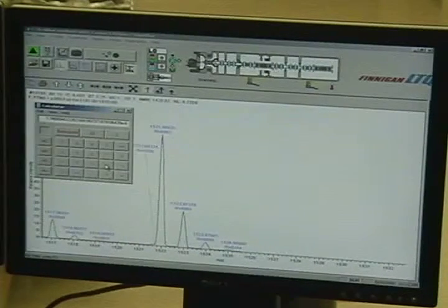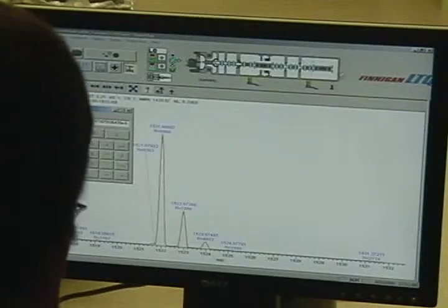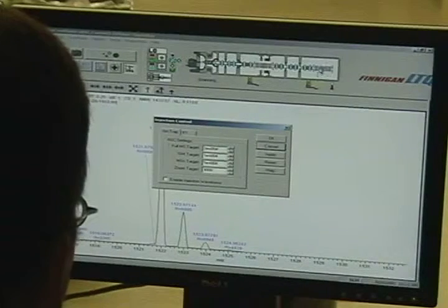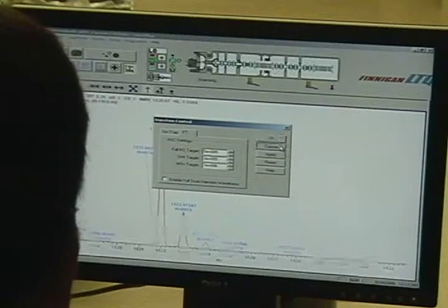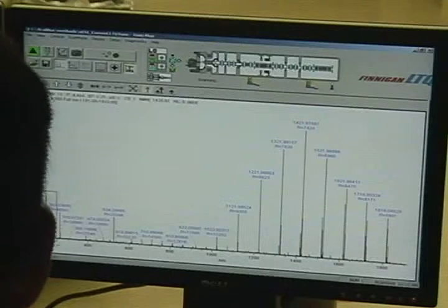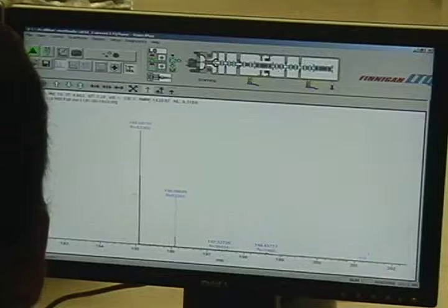Okay, we're 1.9 ppm. So sub 2 ppm is the goal? Sub 2 ppm is the goal now. I make my measurements at sub 2 ppm for 5E5. Okay, so we're going to go back in. Once I know that this calibration is sub ppm at that level, then we're going to go check your 1E6 and see how close you are.